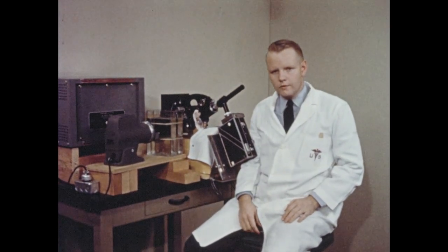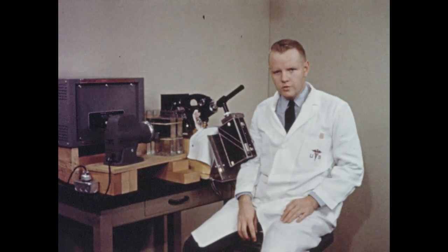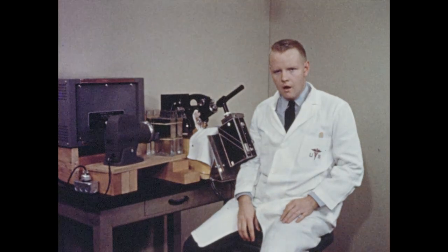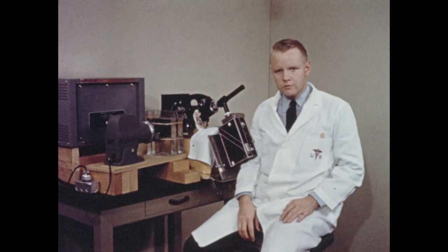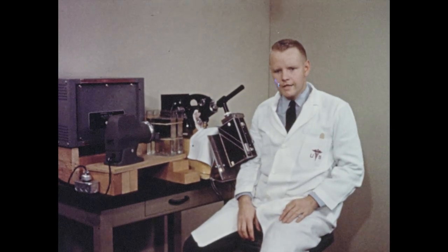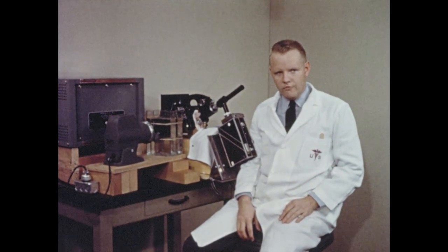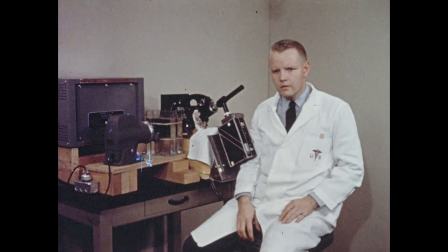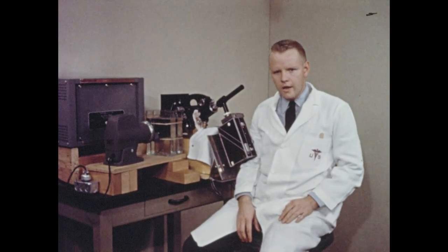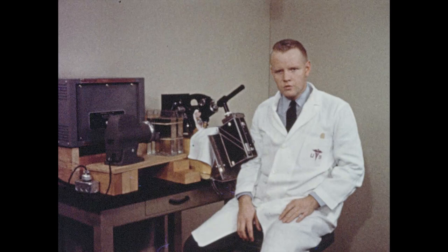We have demonstrated that the rabbit ear chamber technique may be an extremely valuable tool for the high-resolution, high-magnification observation and photography of the tissues in the living animal. This technique may be of immense value for the further investigation of the intimate cellular mechanisms involved in a number of disease processes, including inflammation, neoplasia, metastasis formation, and vascular alterations resulting from a variety of agents such as drugs and irradiation.